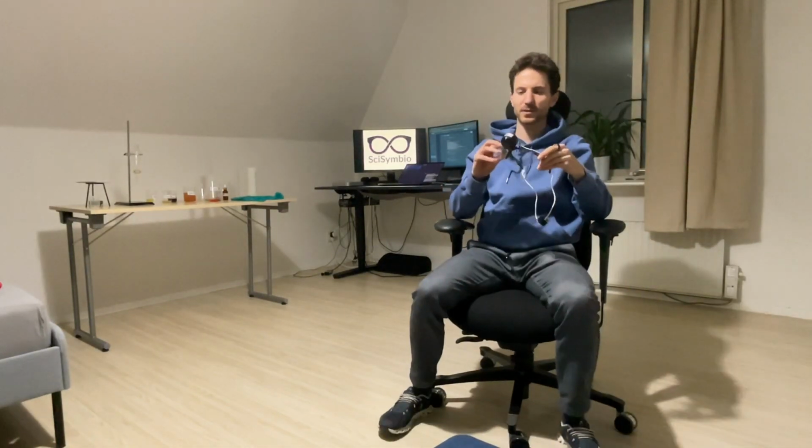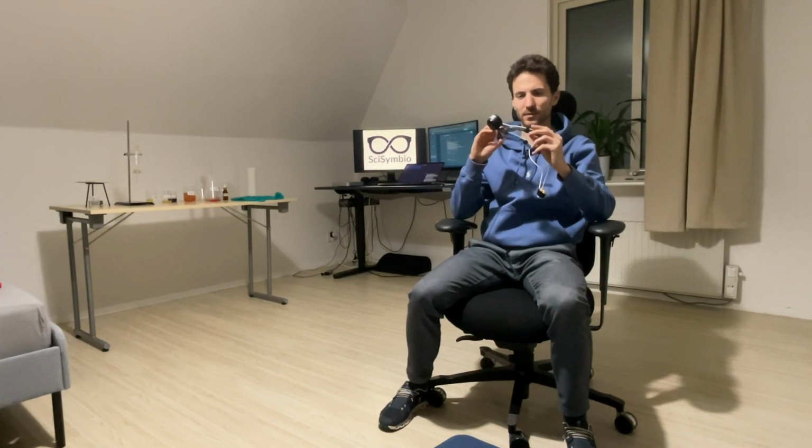our first prototype of our hardware, which is a clip-on camera that is mounted on standard safety goggles for the lab. The battery is placed at the back to lower the weight at the front, which makes it more natural and lighter to use for the user.